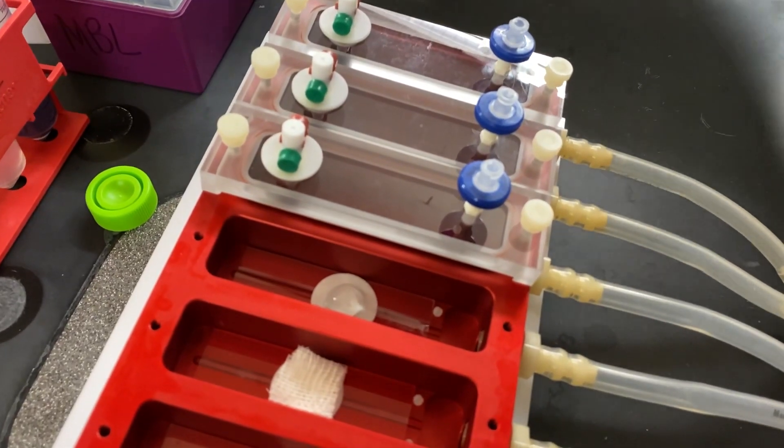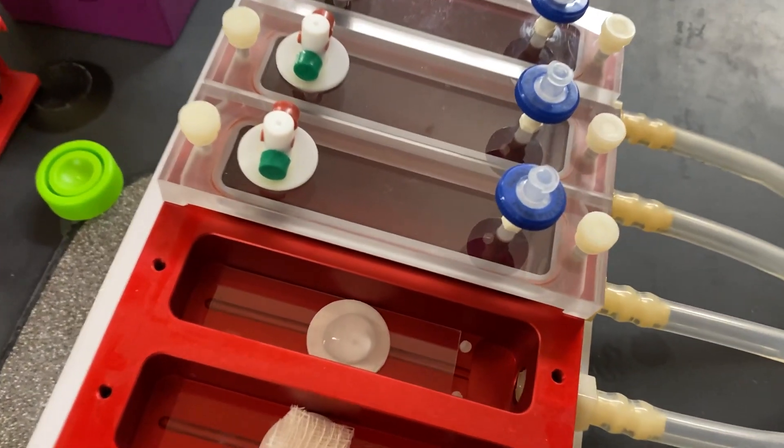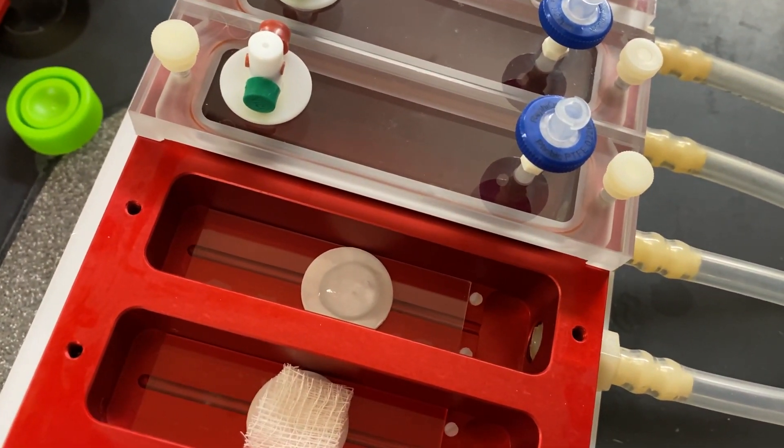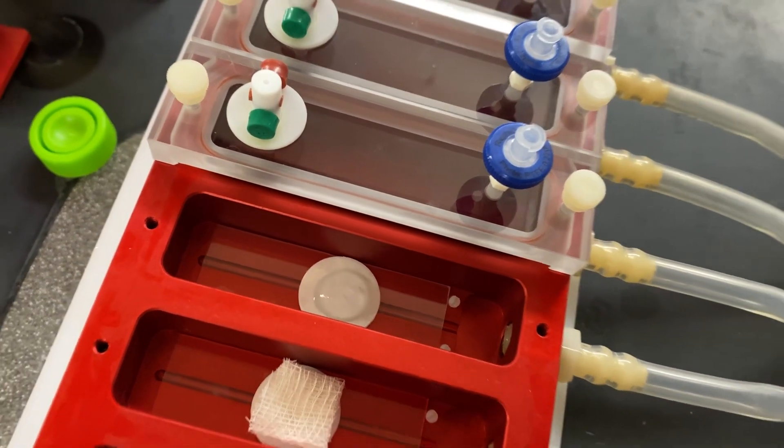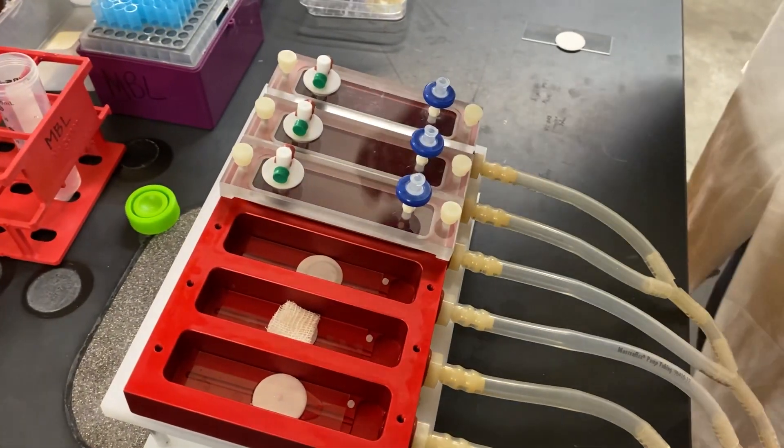We generally let the biofilm grow for three days and sample the biofilm by simply removing the membrane and placing it in the dilution medium or neutralizing buffer.